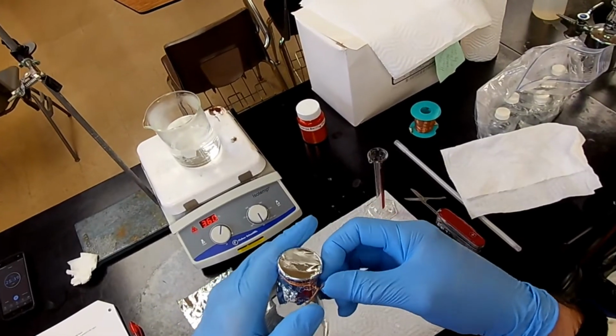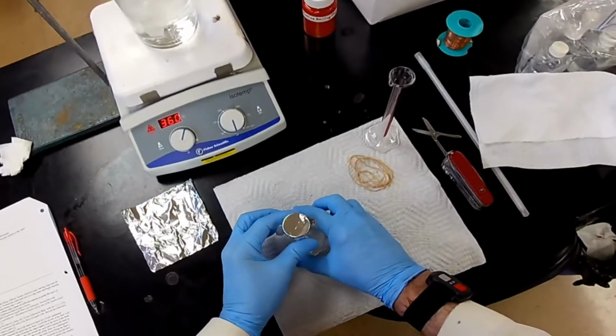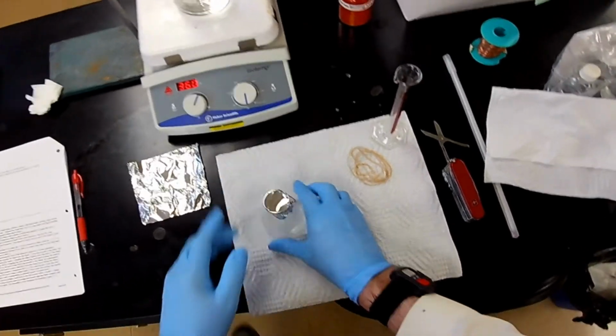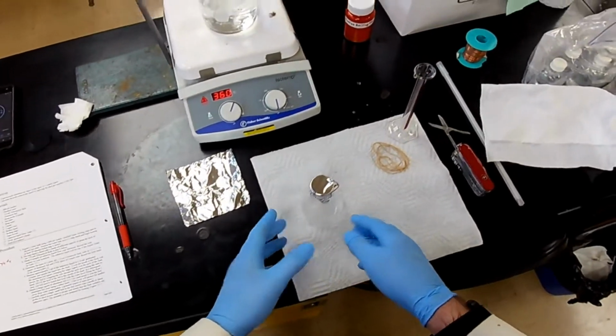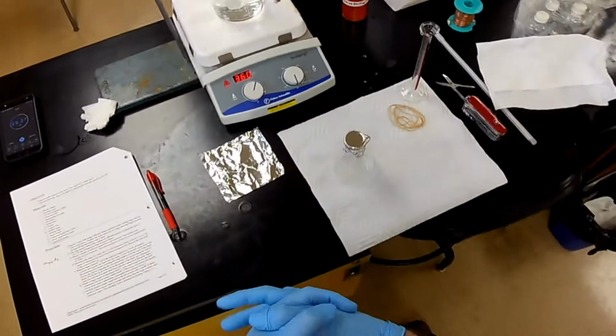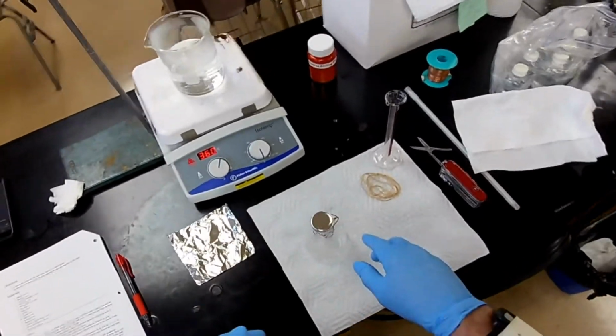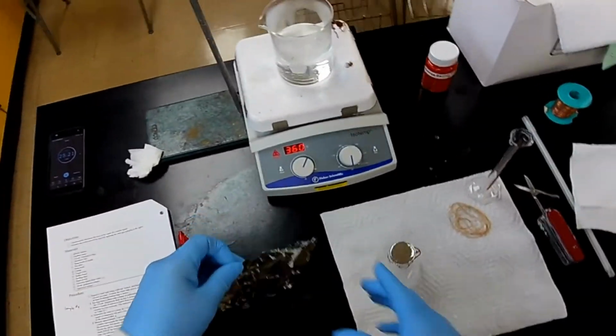There we go. And then put the sharp ends back down like that. Now, that's still the container, but now it has some liquid in it. Well, that doesn't do us any good because that liquid is not gas yet, or it's not gassy enough, and it's still got liquid, so that would bias our results.